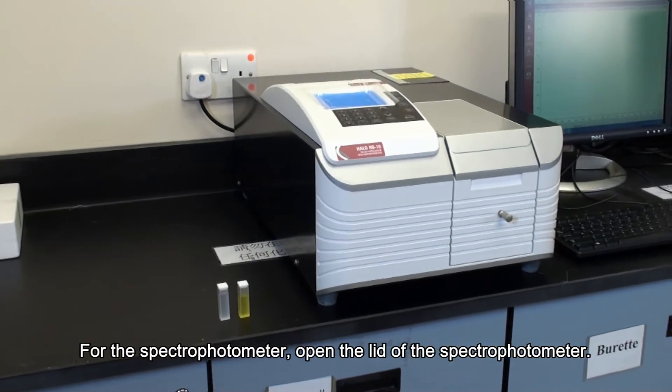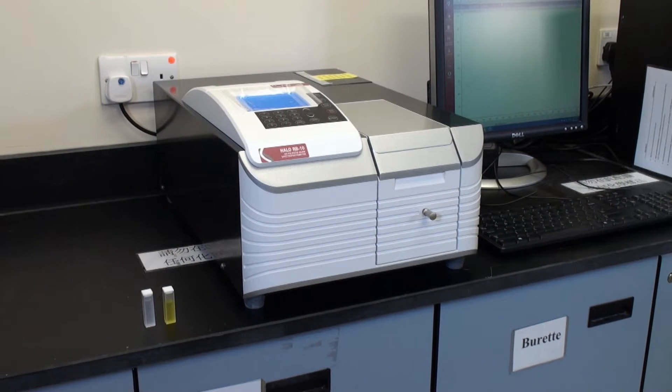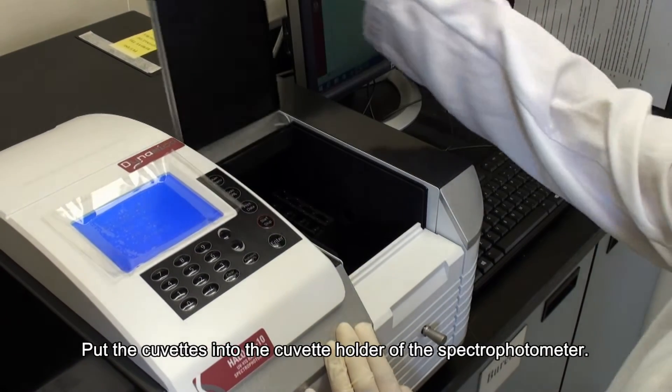For the spectrophotometer, open the lid of the spectrophotometer. Put the cuvette into the cuvette holder of the spectrophotometer.